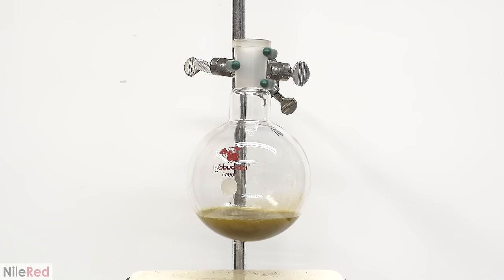Okay, so moving on to the piperine. And I'll use a different spoon just to keep my piperine clean. So, obviously the piperine is going to be a lot more potent, so I shouldn't take as much. So, I actually took about the same amount. So, I have just a little bit at the edge of the spoon here. So, I'll take a taste. It actually just tastes like nothing. It tastes like the spiciness of pepper, but also nothing. It really doesn't taste that bad. And in terms of spiciness, it's really not that bad either.